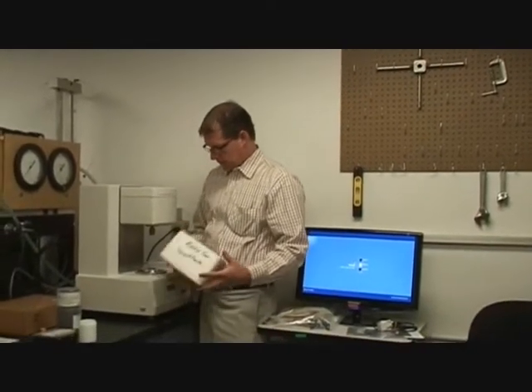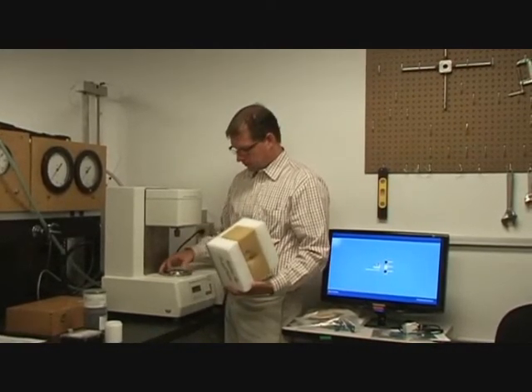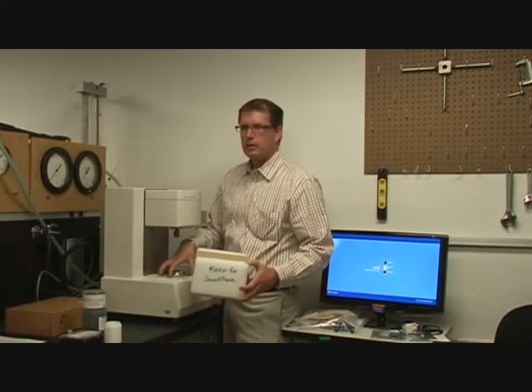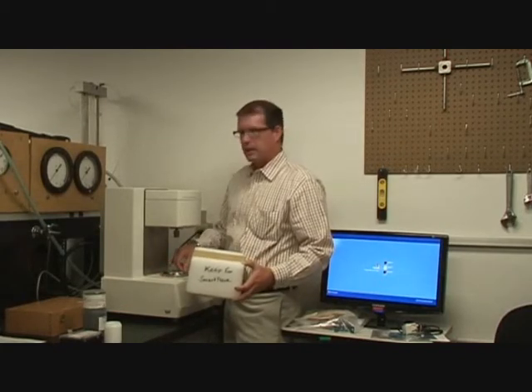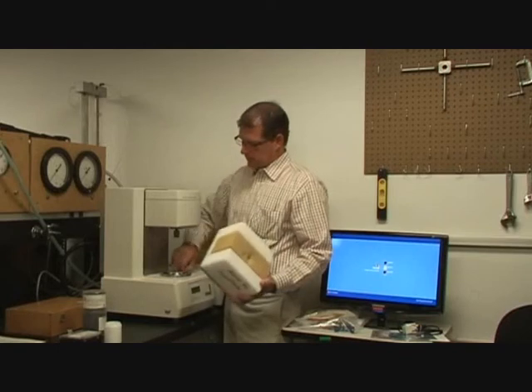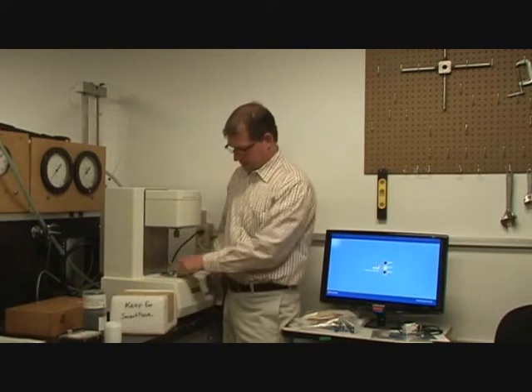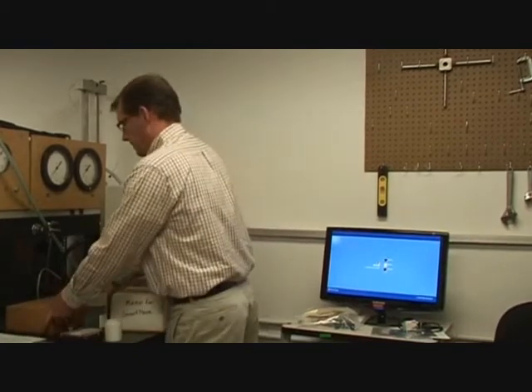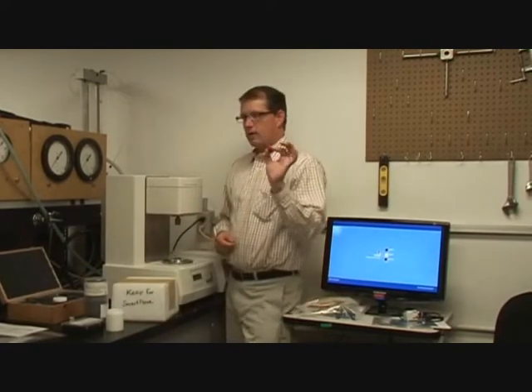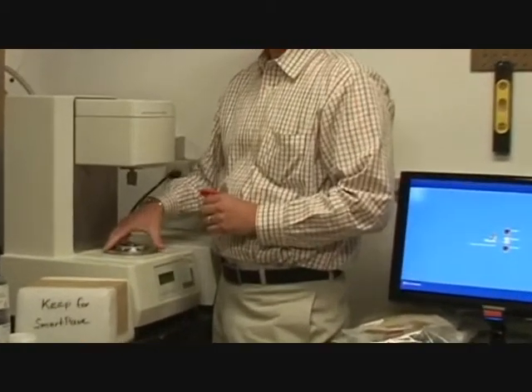If you were going to leave this for a prolonged period of time, the best way to store the unit is to take this foam block. Right now you have the Peltier chamber in there, so I'm not going to go through all the steps to remove it, but I'll tell you how you can do it. You take these little pieces off, and there are 3 screws accessed in here. What you can do to remove it is take the smaller of the Allen keys, remove the 2 left-hand screws, and then remove the right-hand screw. And then this piece will pop out.